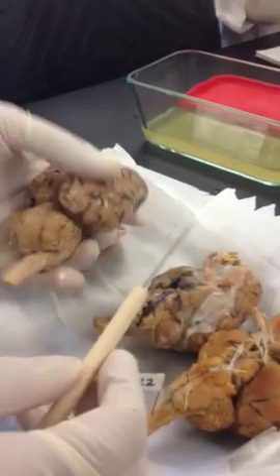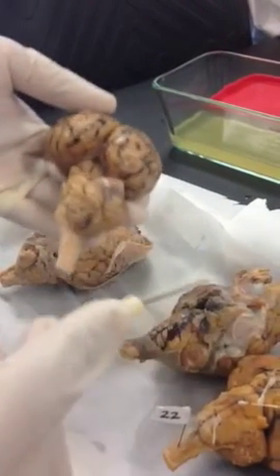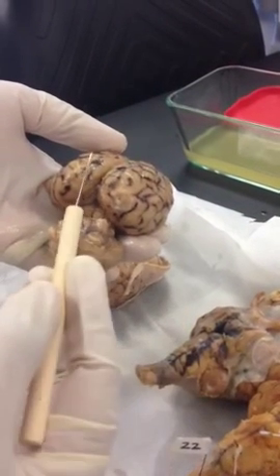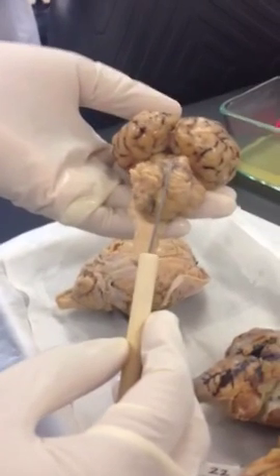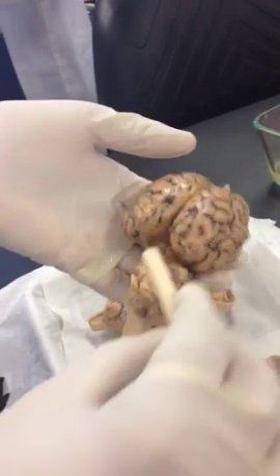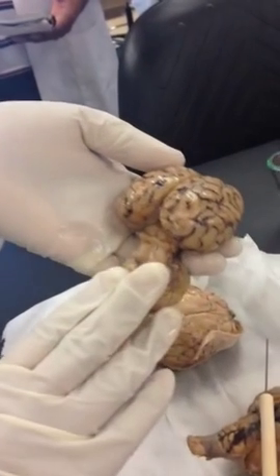Okay, if you take the brain in your hand, first of all, you need to figure out whether it's the front or back of the brain, whether it's the right or left half of the brain. So how can you do that? The first key or the first hint or the landmark is your cerebellum. Looks like a little brain. Okay, this is all your cerebrum. Cerebrum makes up most of your brain. Okay, cerebellum is in the back.